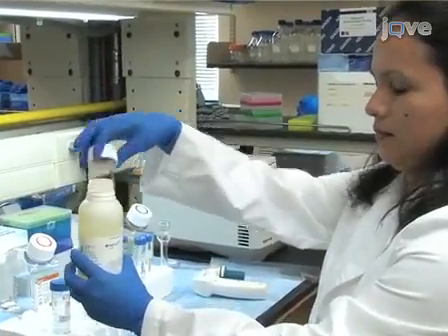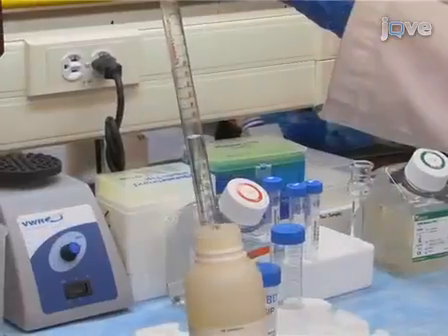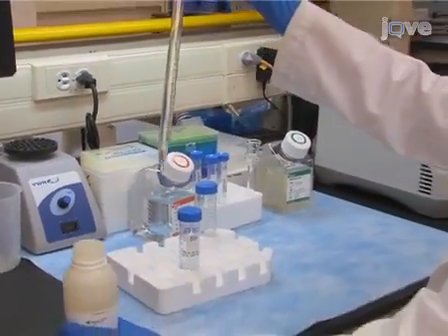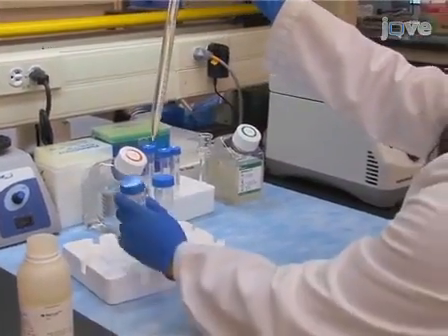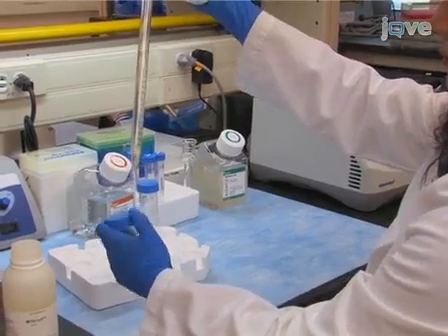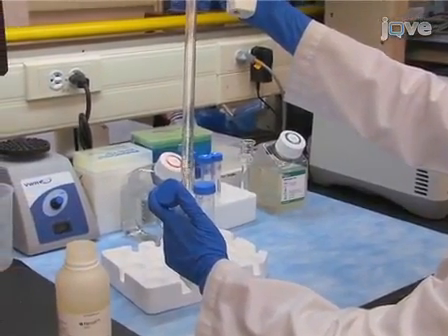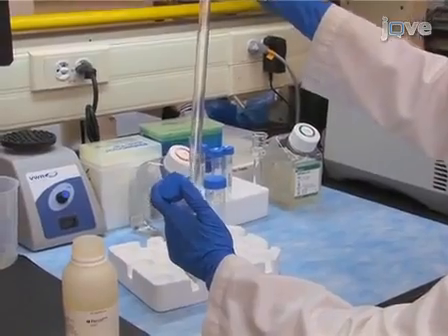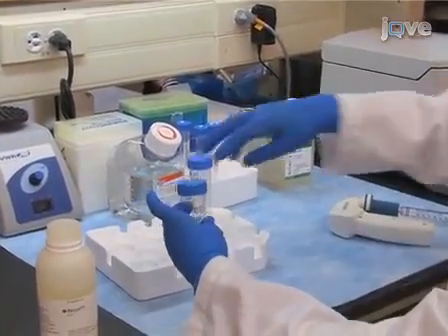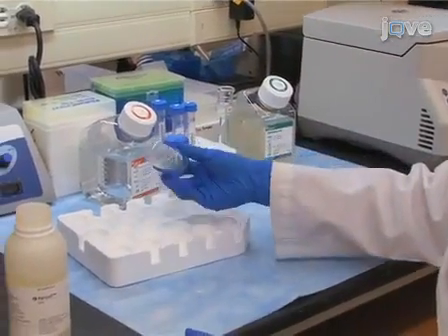Prepare the reagents that will be needed for this protocol, starting with four millilitres of stock isotonic percoll, referred to as SIP, per brain. To do this, combine nine parts of percoll with one part 10 times HBSS without calcium and magnesium.